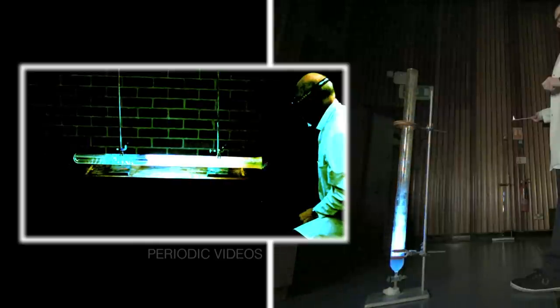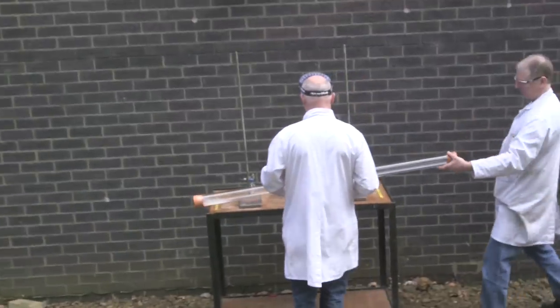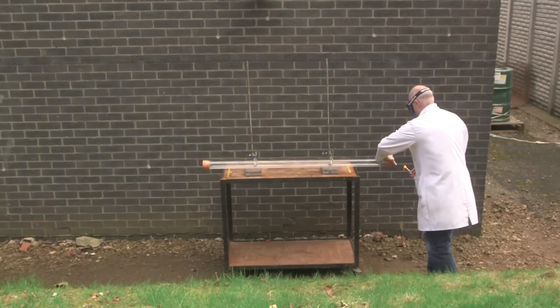So we did another experiment with a tube with a rubber bung at the end instead of being a closed big test tube. So what we thought might happen, the bung might shoot away like a cannon.